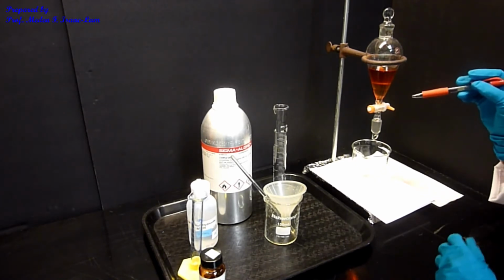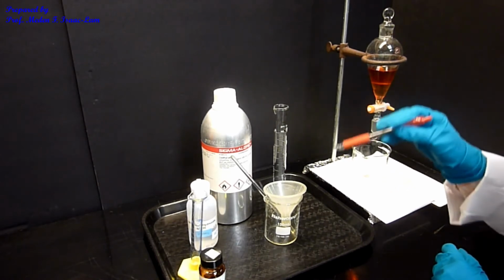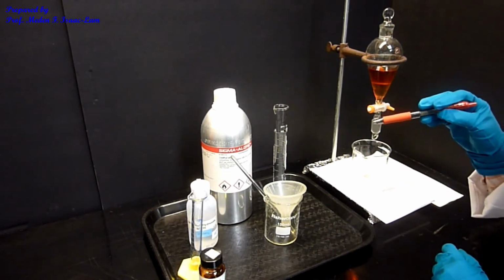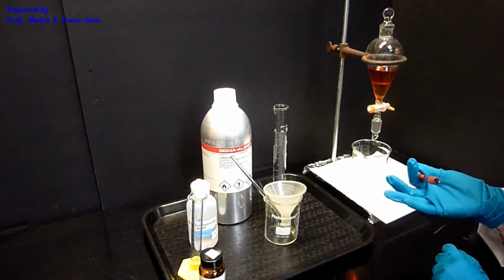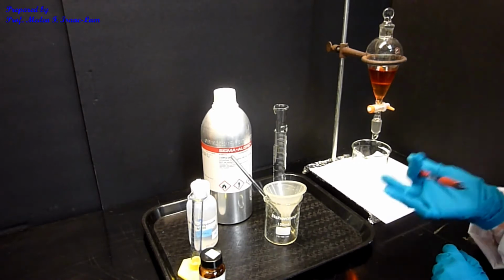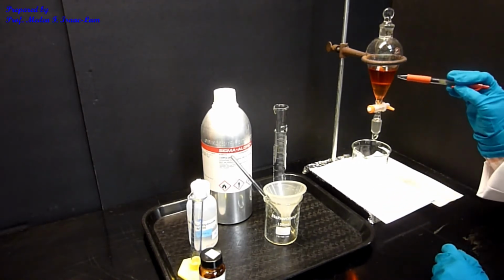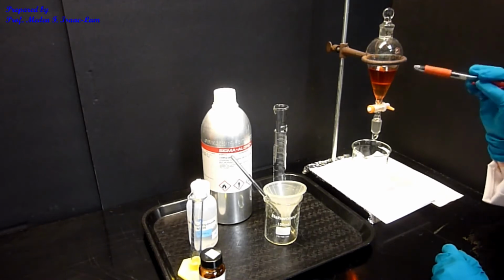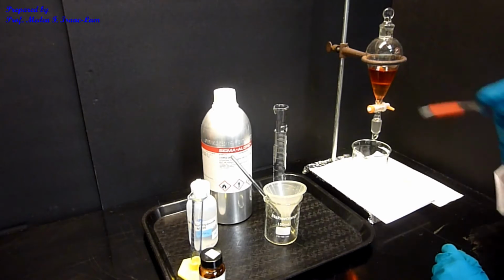So we also define these as the organic layer and the aqueous layer, because the organic layer is the solvent which I added, the diethyl ether, and it is lighter than the aqueous solution, which is your base, sodium hydroxide and water. The base is going to be the lower layer. The upper layer contains your solvent, which is diethyl ether, and you now have 2 layers.